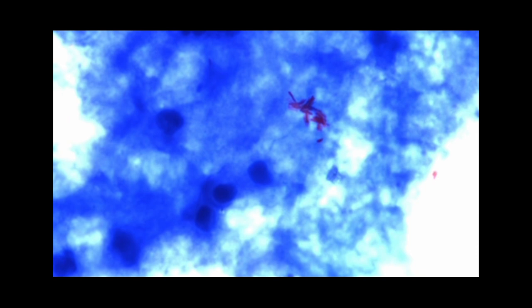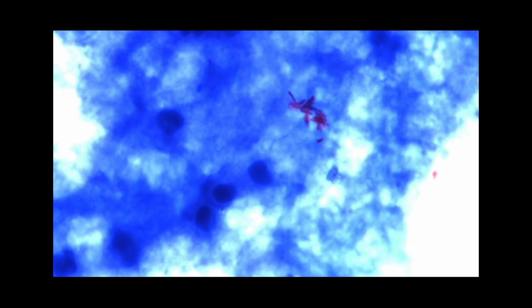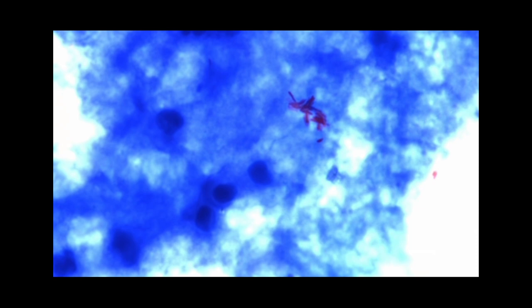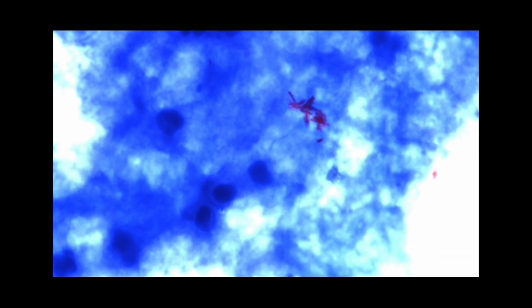After the staining procedure, the results you can see under the microscope are: the cell's nucleus varies in color from blue to dark violet to dark brown. The cytoplasm is blue-green, or if the cytoplasm is eosinophilic or acidophilic, then the cytoplasm will be colored pink. The microorganisms will stain blue-violet, while the leprosy bacilli are colored magenta red or red against a blue background.